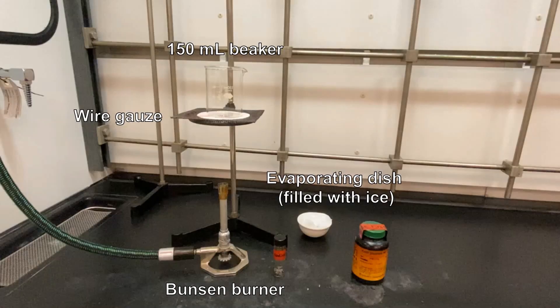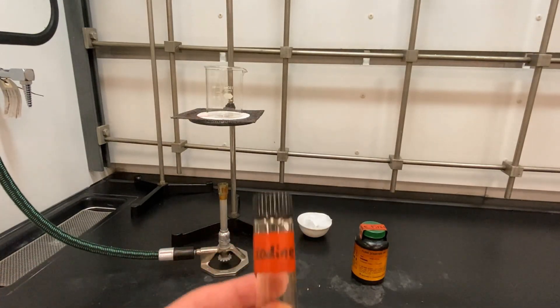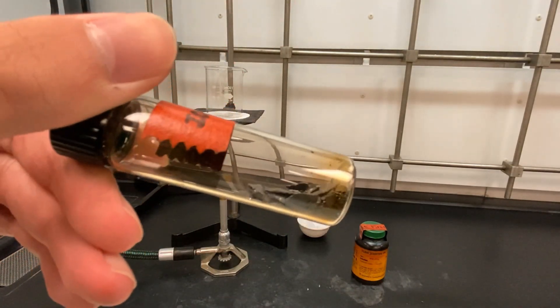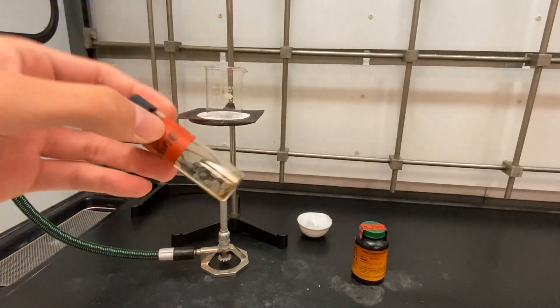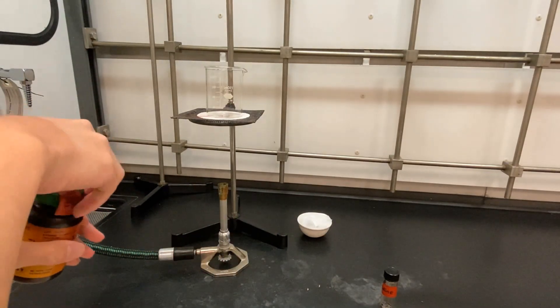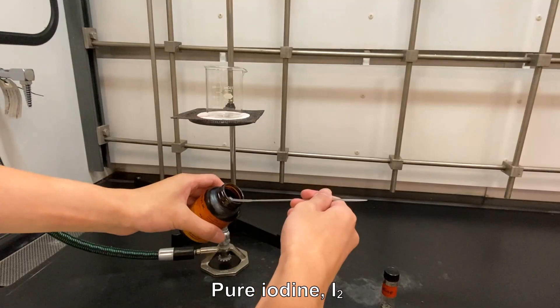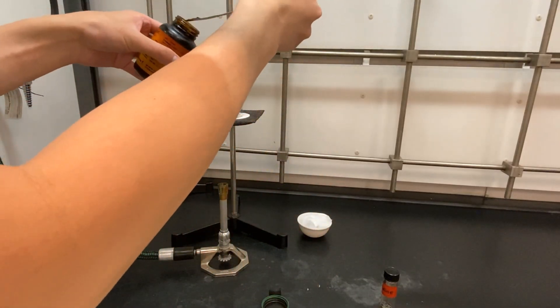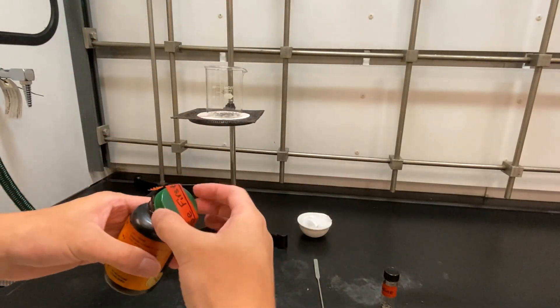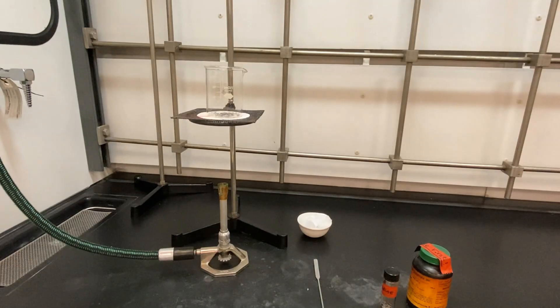Our first test is all about iodine. This is a vial containing iodine. As you can see, it's a solid at room temperature. Make other observations. This is a reagent bottle containing iodine. A few small pieces of iodine are added to a 150 mL beaker on a ring stand.